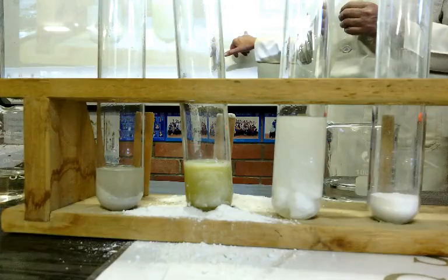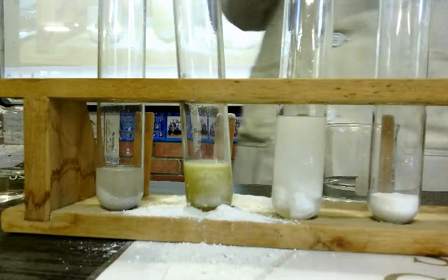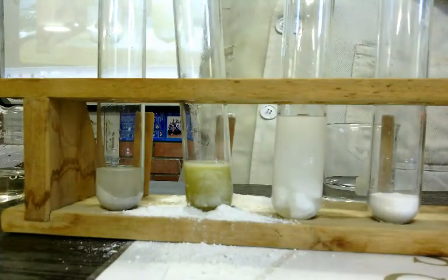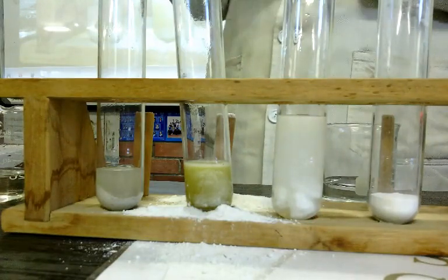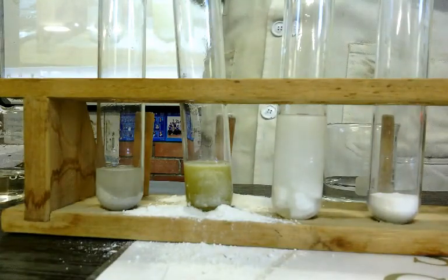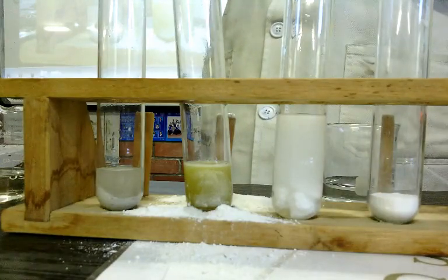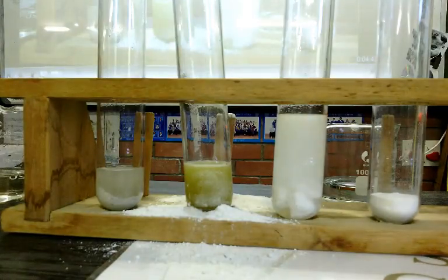Is it because of its surface area? Yes. The powder has a very big surface area. You can spread a powder out and it can cover a large area. You understand what I'm trying to say? Yes. Or we could say the state of division. The powder has a higher state of division, so it's got a higher surface area, so the acid can get to more of the calcium carbonate particles in the same time. So the reaction is faster with the powder than with the chunks.